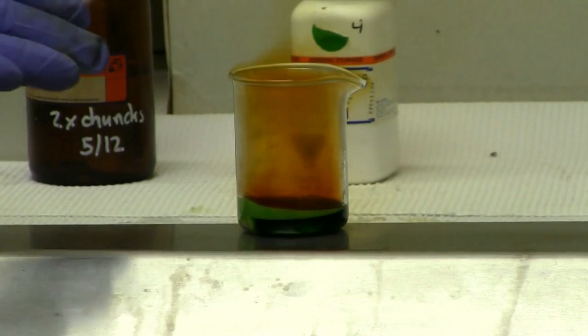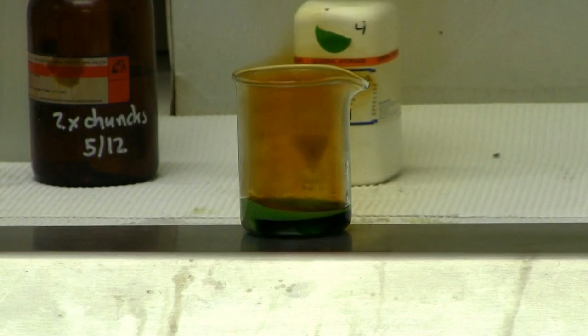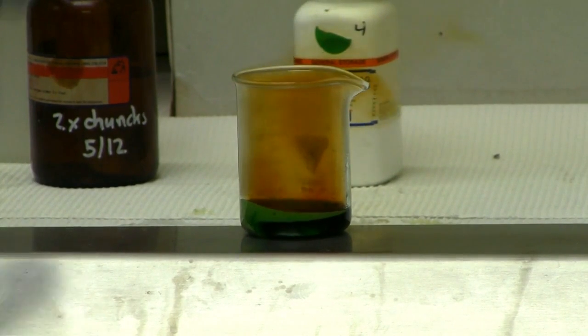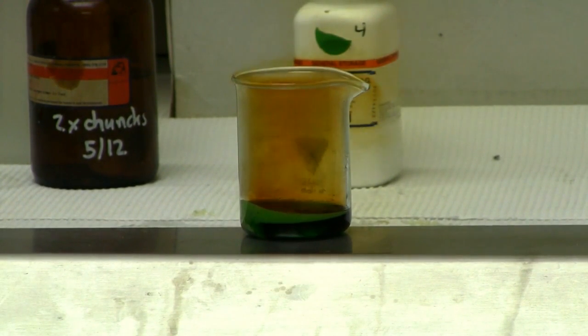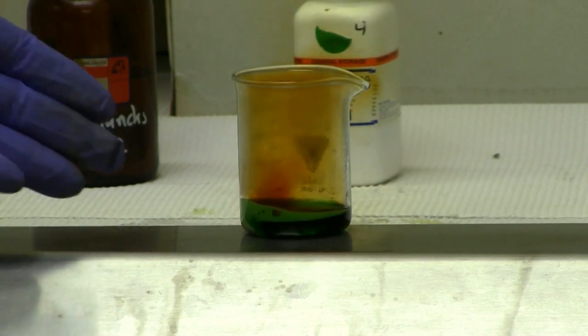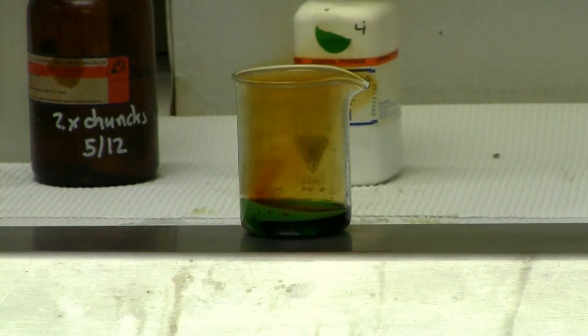You'll notice I have the sash all the way down and my face velocity is at 100, so I'm not terribly concerned about the gas coming into our breathing area. And that's why you want to do this in a well-ventilated area, because this particular reaction is not only exothermic, but it also produces acid gas. And those acid gases are not only deadly to you, but they're also corrosive to your skin and also your eyes. The gas itself in a large enough concentration will cause permanent eye damage. So, like I said, very exothermic and relatively not good for you.